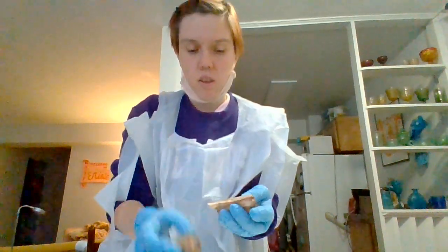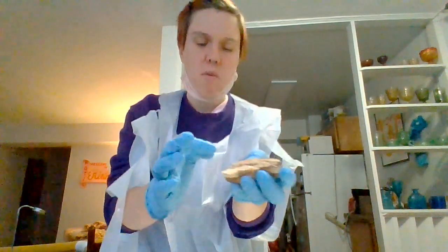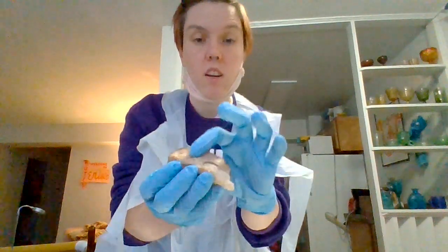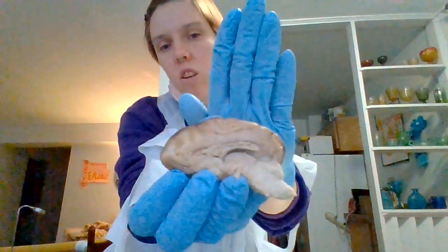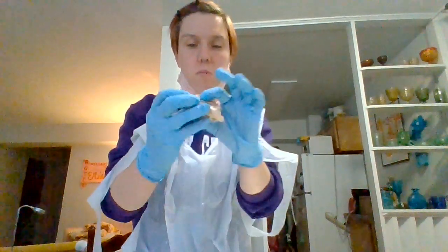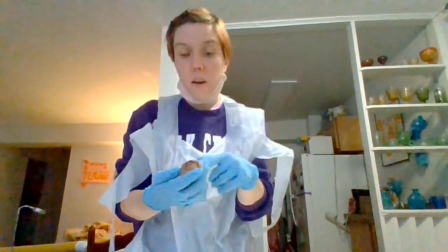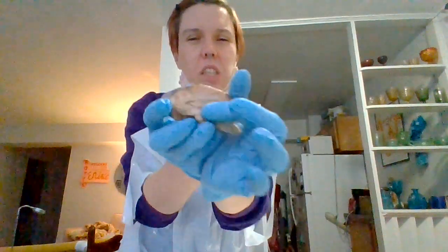Okay, we have the corpus callosum. This is a nerve bundle. I'm going to try and show it right there. Or maybe it shows better here. This little circle structure is the corpus callosum. That's around the thalamus, just thereabouts. The thalamus is an egg-shaped circle, and it takes in all of the incoming information in your brain, like a brain processing center. It's actually really small, which I find interesting. And then right there, can you see, is the hypothalamus. The hypothalamus is what keeps your brain in homeostasis.